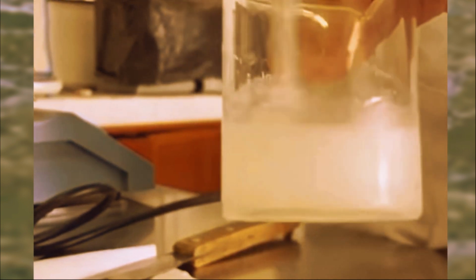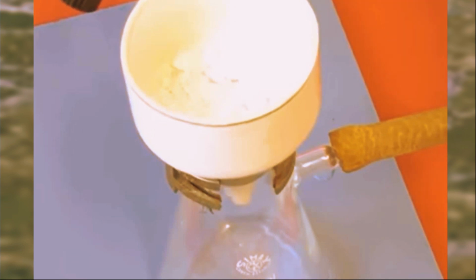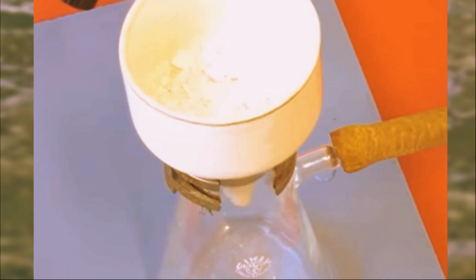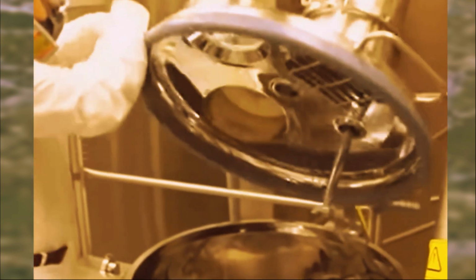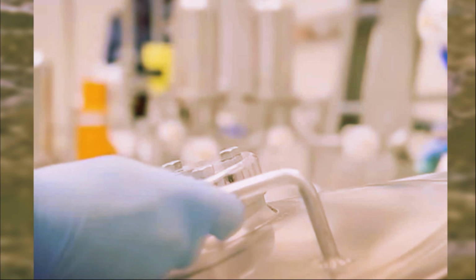It may seem small, but the acetyl group packs a punch. It shapes molecules and their roles in many chemical processes. The catalyst also joins the mix. It creates the perfect environment for the reaction to take place, acting like a conductor, directing the action. Like two old friends, the acetyl group and salicylic acid bond. They form a new compound, acetylsalicylic acid, or aspirin. But it doesn't end here.